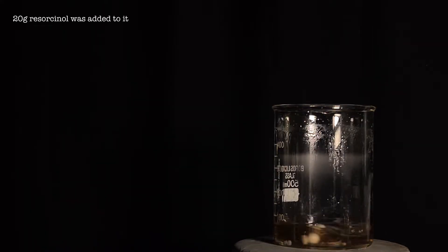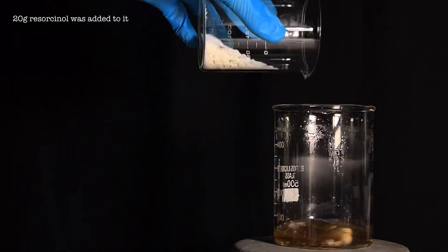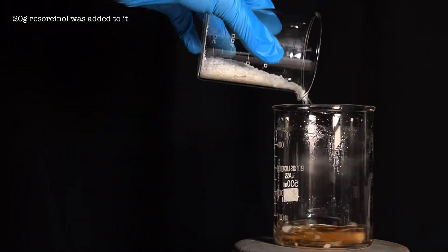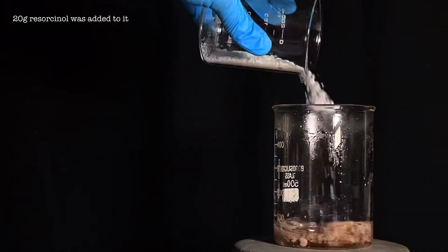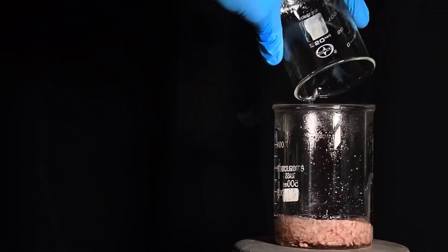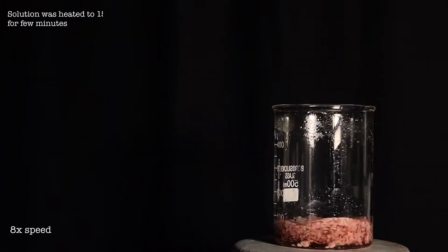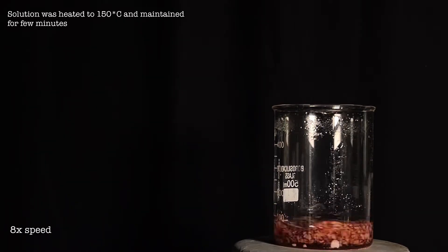After the solution turns clear, 20 grams of pure resorcinol was added to the beaker. Stirring and heating was done. The solution was heated to 150 degrees C and maintained for a few minutes.